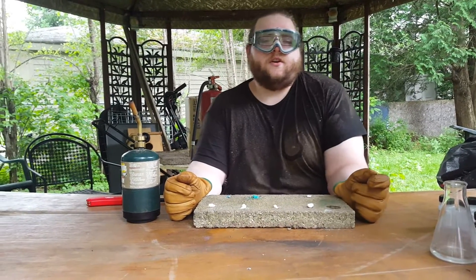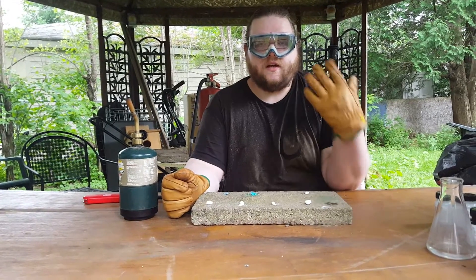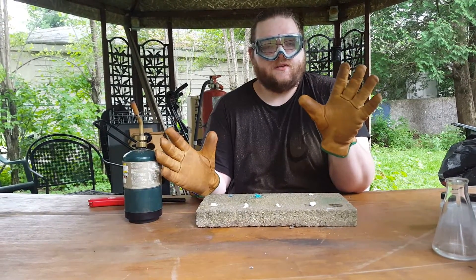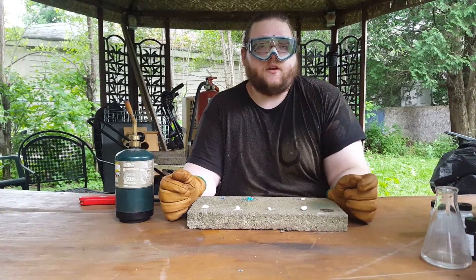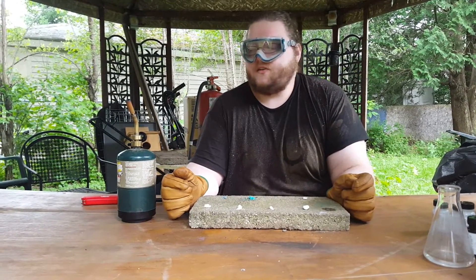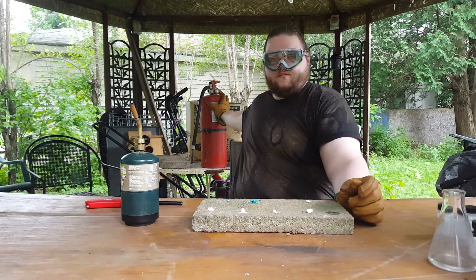The safety precautions we are using for this experiment are, of course, our safety goggles, and we are also using gloves because we want to protect our hands. And since we are working with flames and flammable materials, we also have a fire extinguisher.